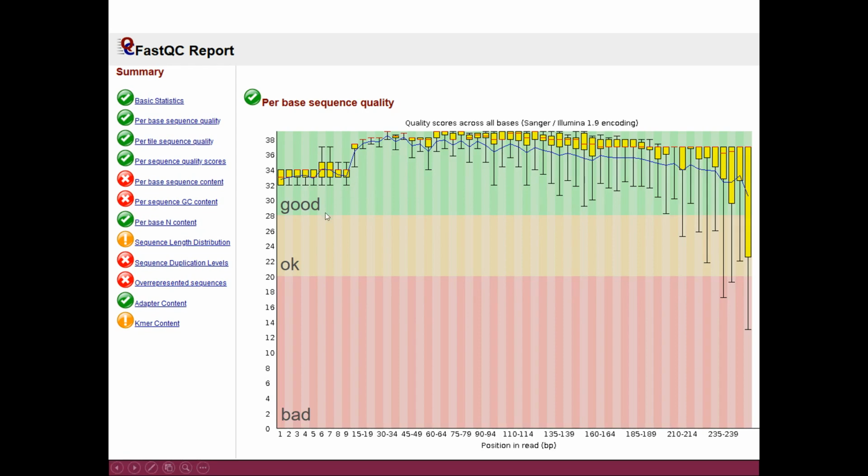Now the developers of FastQC have also decided to color the background of this plot to help you to interpret it. So essentially, if your yellow boxes stay in the green area, that means the quality is very good. If they start to hang into the orange area, it's still okay, but the quality is going down. And if your boxes fall into the red area, that means that the quality is bad. So what typically happens is that towards the ends of the reads, the quality starts to deteriorate.